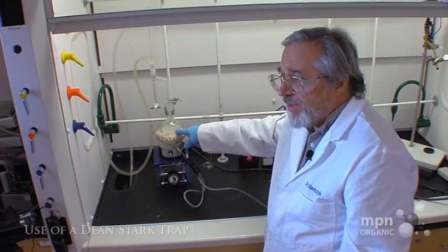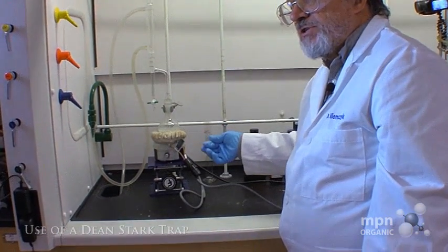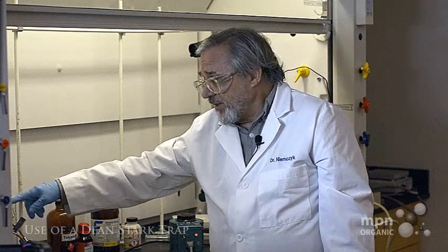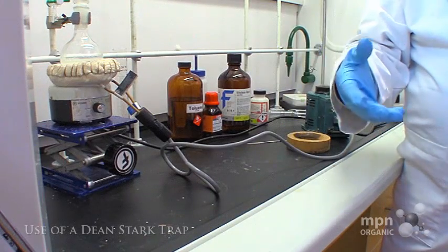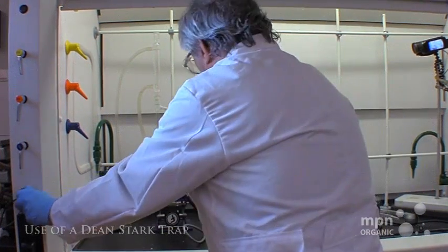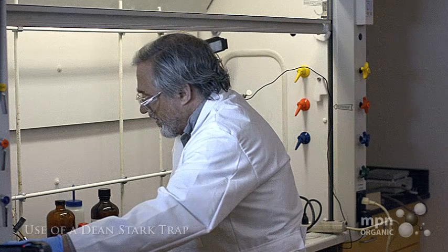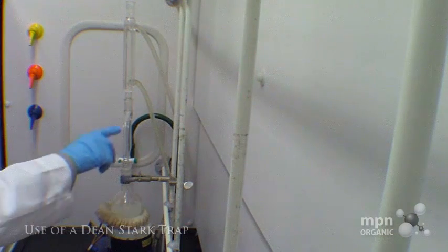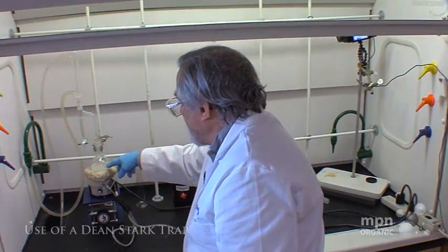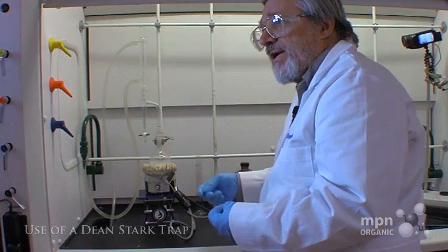As I heat up the toluene, the reaction occurs. We know that when we write a balanced equation for this reaction, we get water as a byproduct. The water and the toluene are going to distill over up into the condenser over here. I'm going to start that now. And it's going to condense. One thing about this azeotrope that's kind of cute is that it acts almost as though it's a pure material that's boiling, and it's homogeneous.